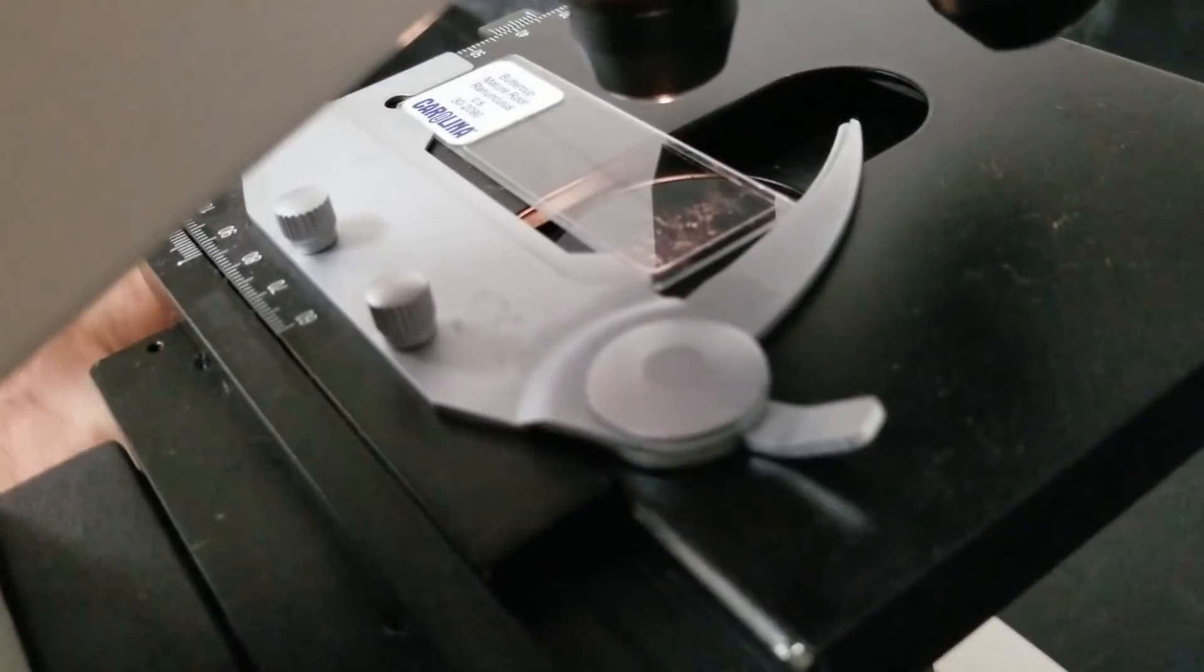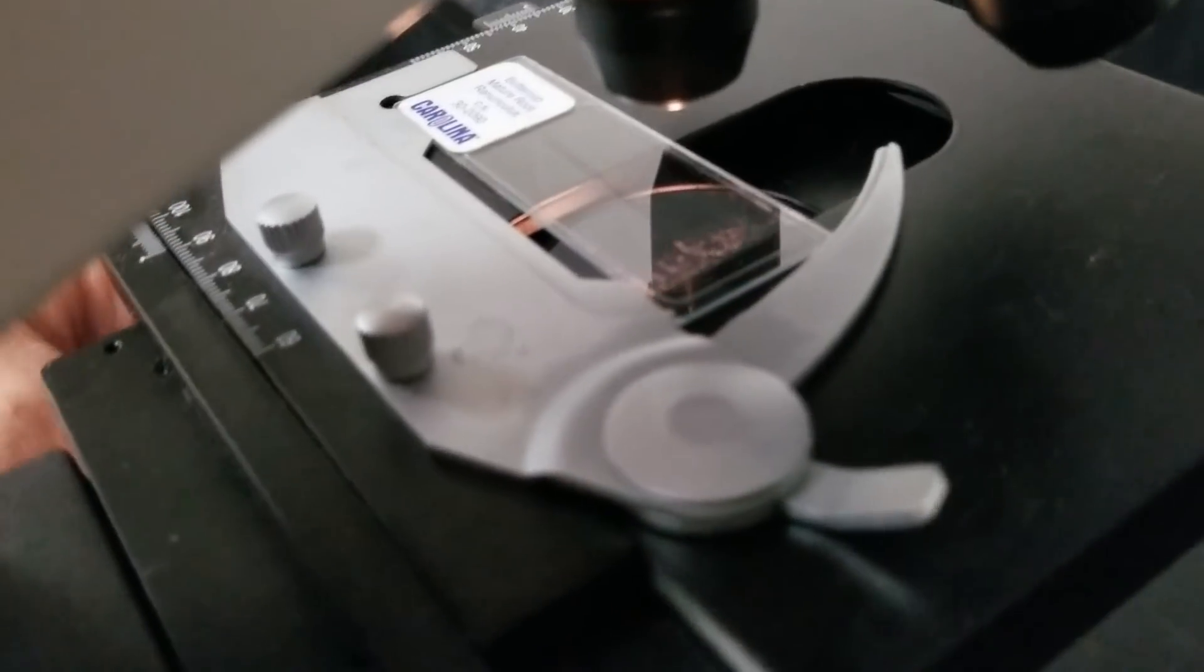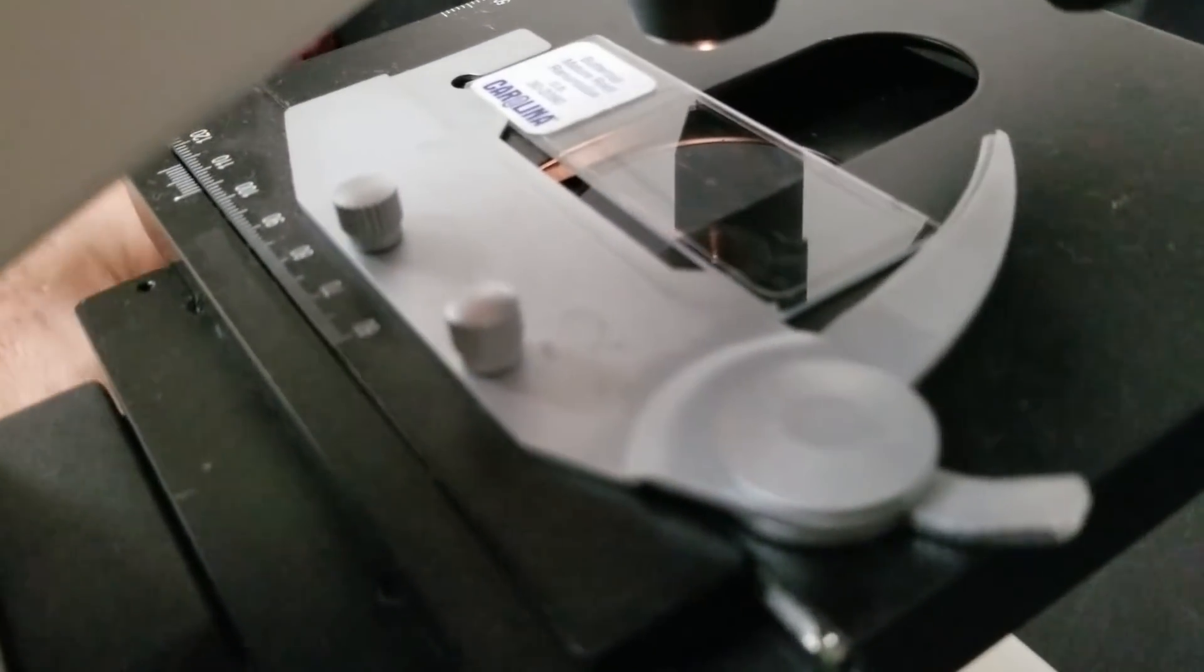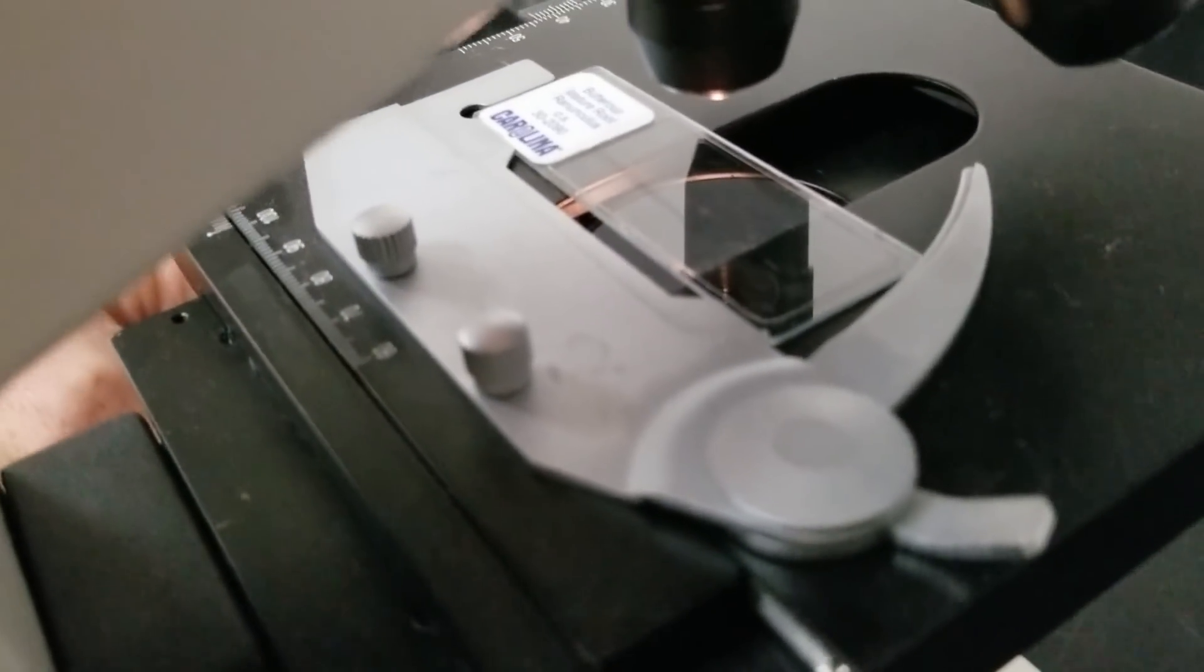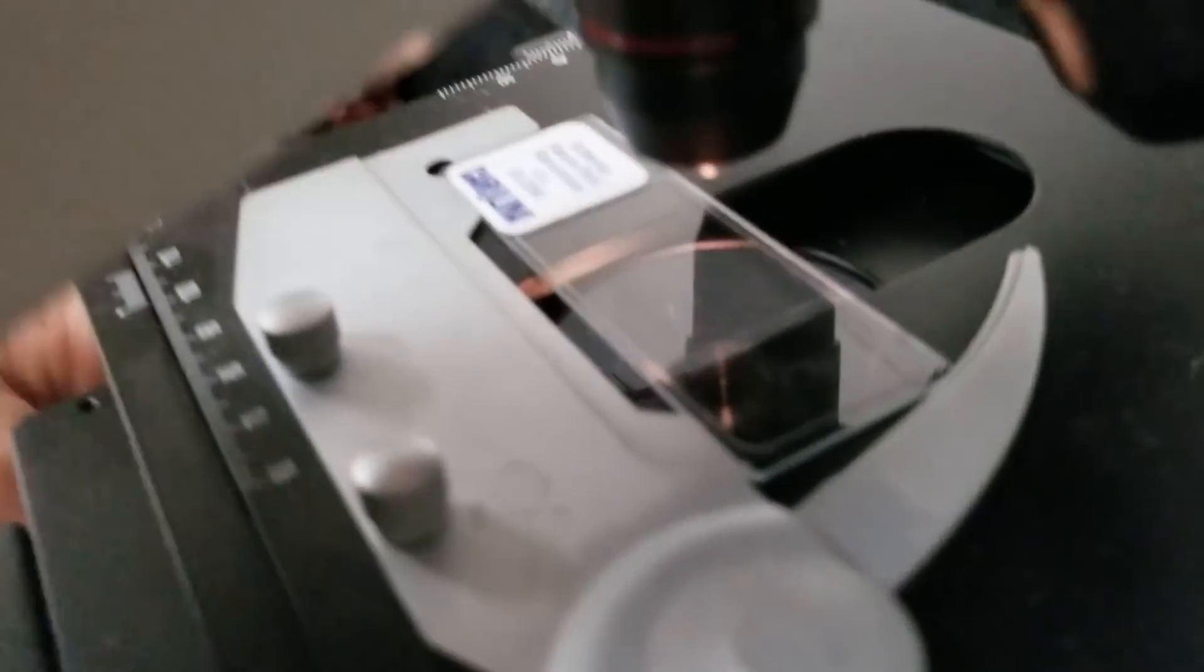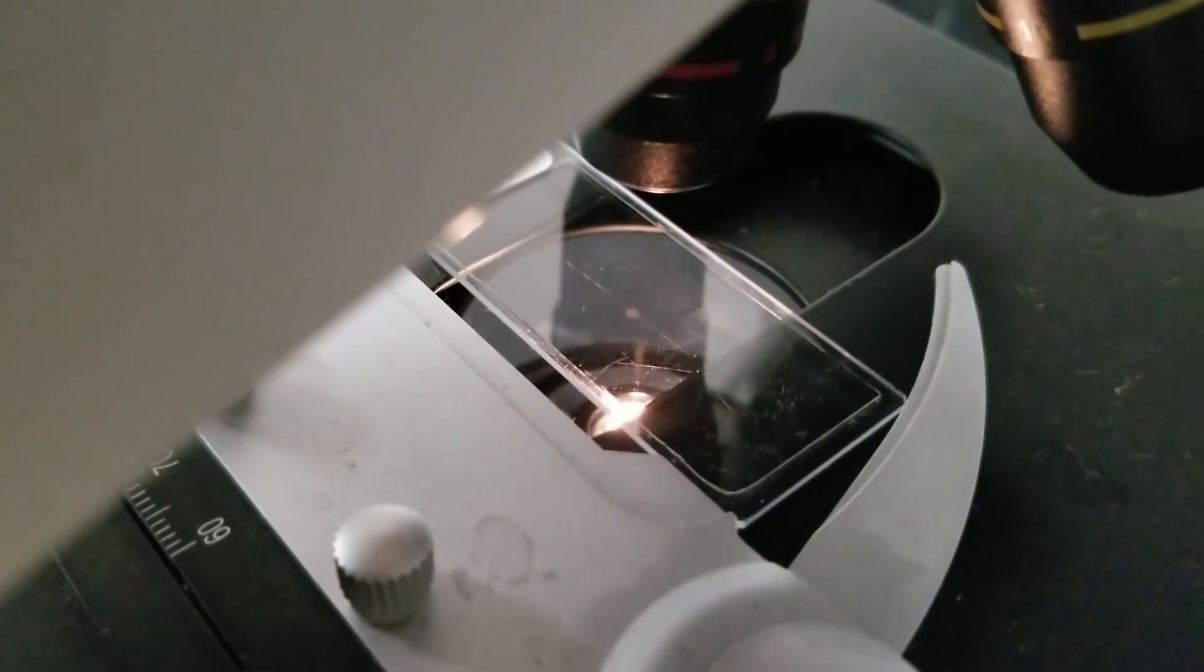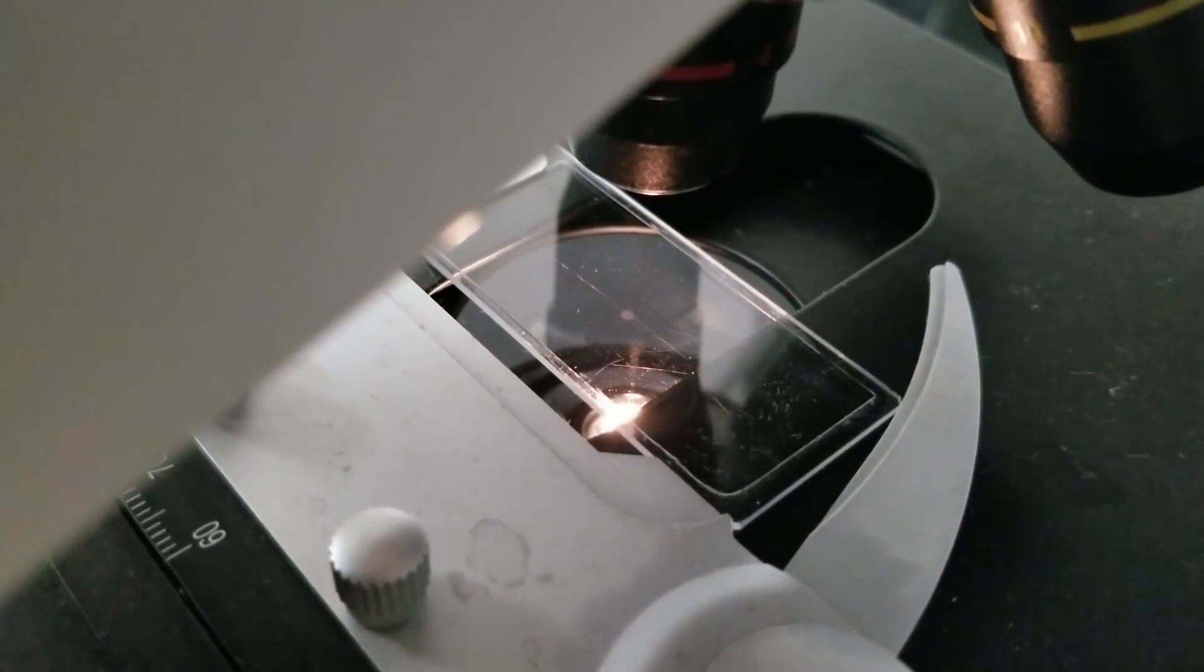That looks good enough. We can see the little dot. That's what we're trying to see. That little dot in the middle of the slide. Put it on the lowest objective. It's very easy to focus to the lowest objective first rather than trying to find it on a very high objective.